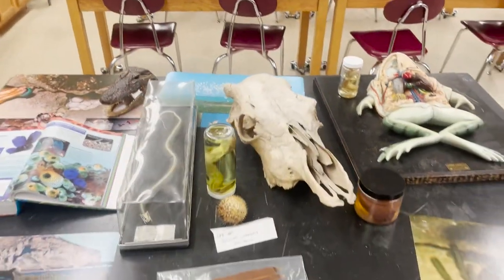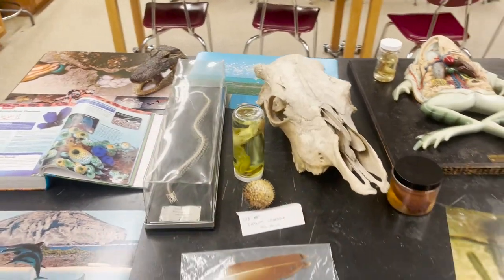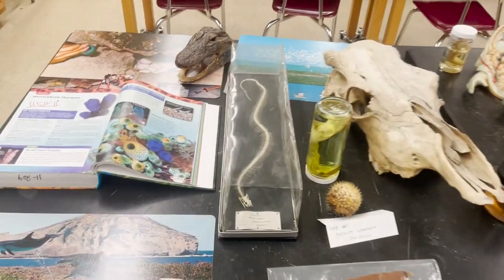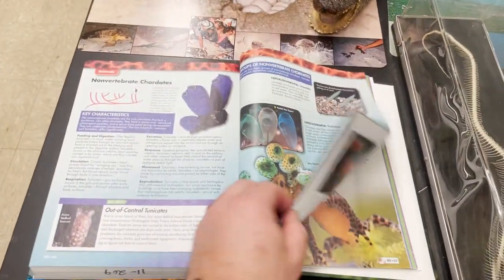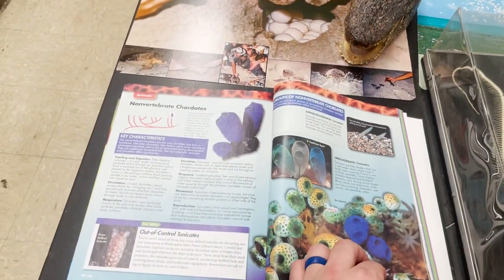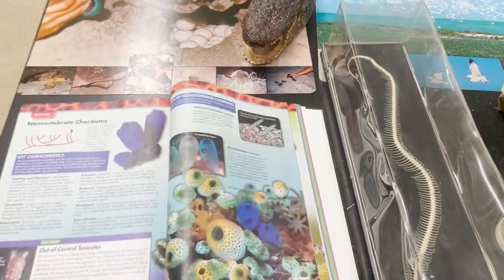While you're doing these you're going to pick two specimens. Now some of these like the Chordata table have a lot on there — you're just going to pick two of them. You're going to draw a sketch of two different specimens that represent your phylum, and then you're also going to take some notes. To help you with the notes, that's what the Diversity of Life pages are for. You'll notice Phylum Chordata has quite a few — Chordates, more Chordates — the first two pages include some weird non-vertebrate ones, and there's a whole bunch of other features here as well.